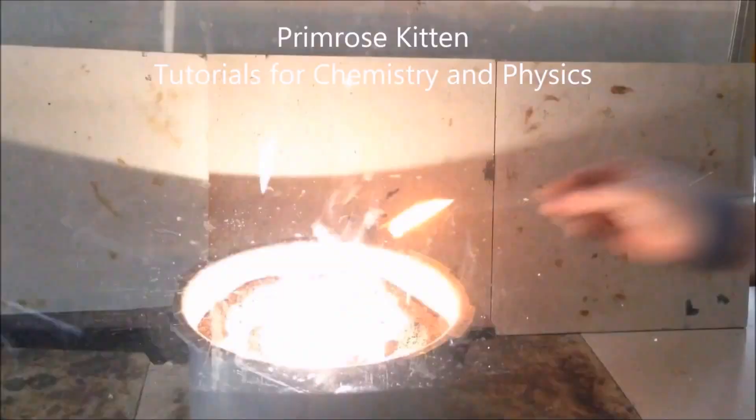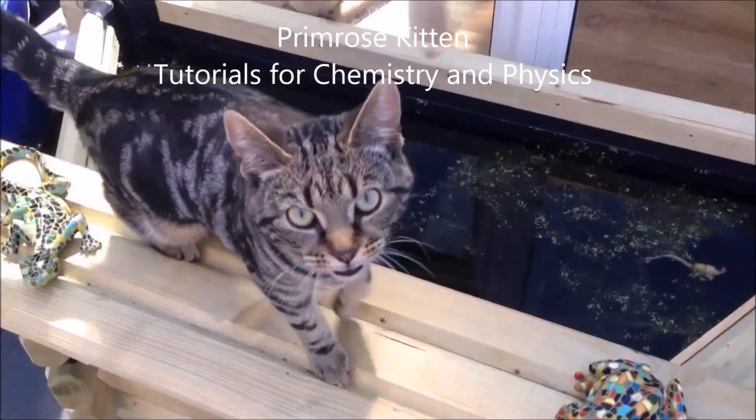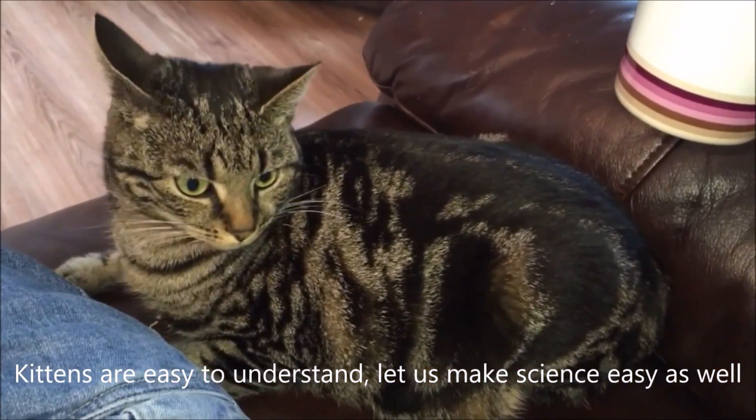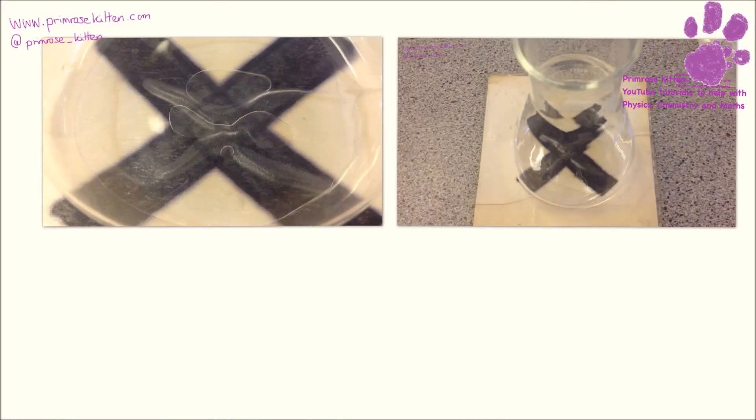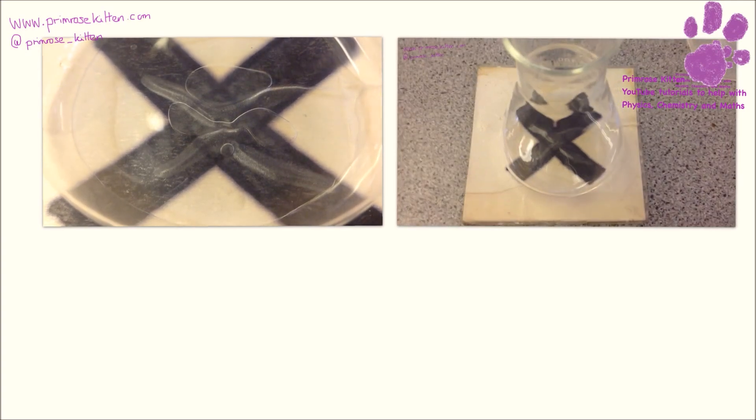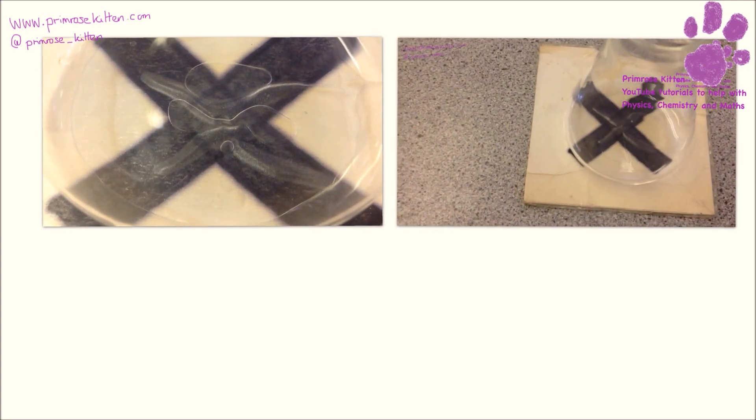We can follow a rate of reaction by looking at it. Here is another way of measuring the rate of reaction that I'm sure you are all very familiar with. This is a very common one in class.